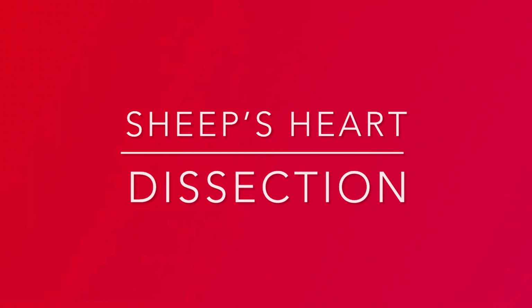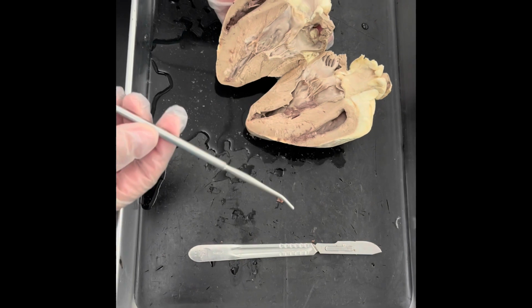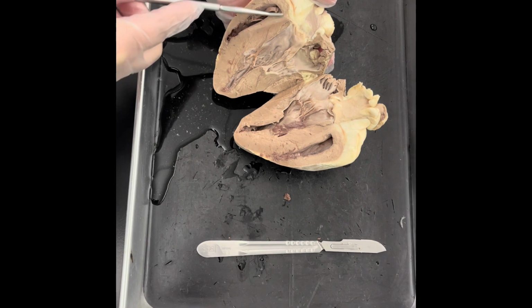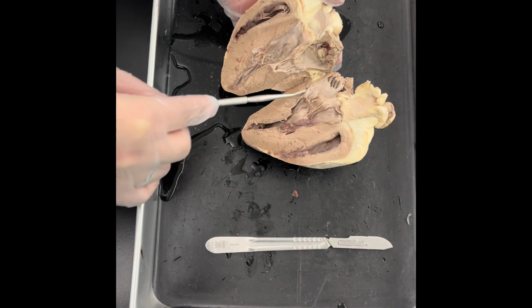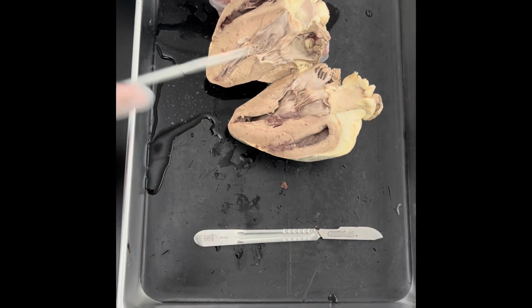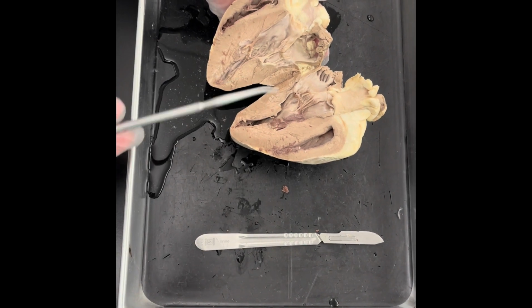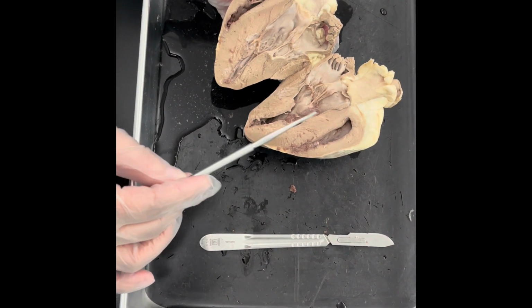This is the real thing. Okay, so what you're looking at is a coronal cut of the heart. And what you're looking at right here is the right ventricle, and this is the left ventricle. On this side, you're looking at the other half of the left ventricle right here, and this is the right ventricle. I know it because of the thickness of the ventricles. The left ventricle usually is thicker than the right ventricle. So if you notice, the wall here is thicker.